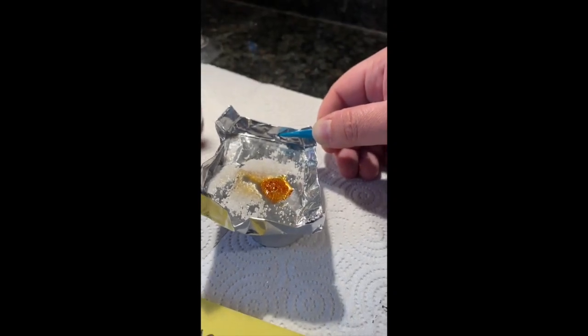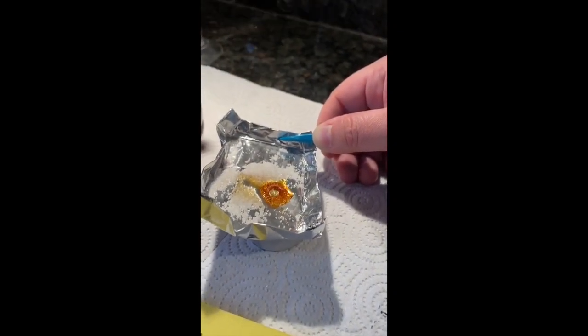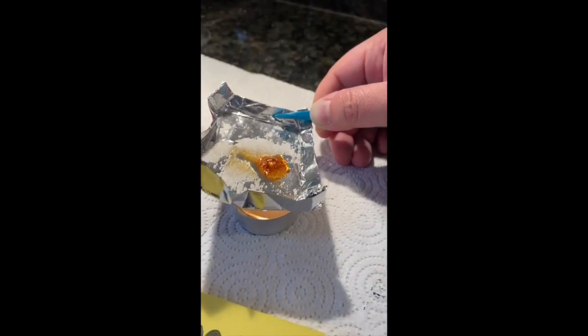Oh, I chose to come on this at a good time. Kind of just pay attention to some different things: the color, the state of matter, the movement. This looks really cool, actually. You can see, I think, some things coming off of that, which is perfect.